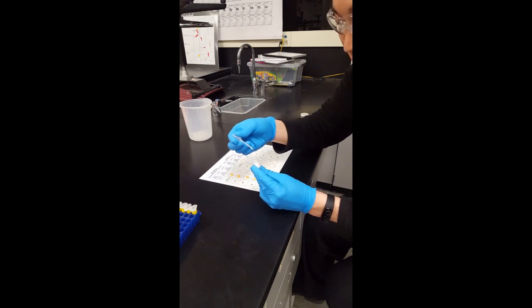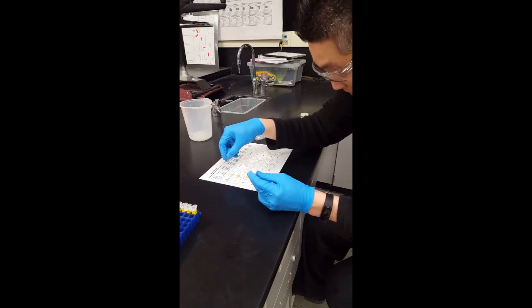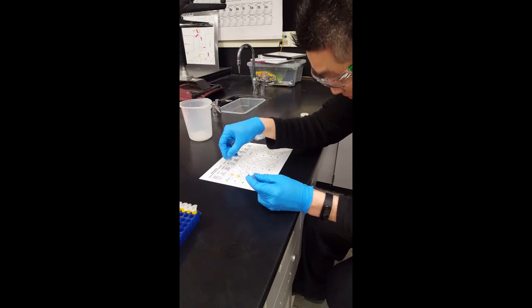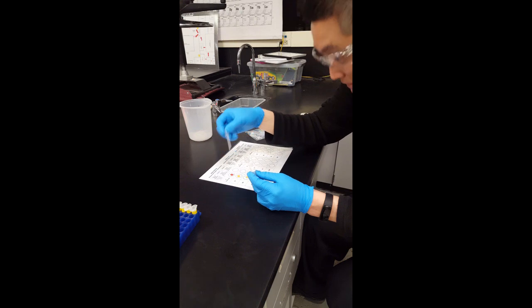Be sure not to take in too much because you only need like one drop, one or two drops. So maybe like two drops.